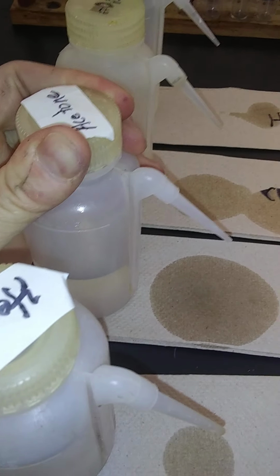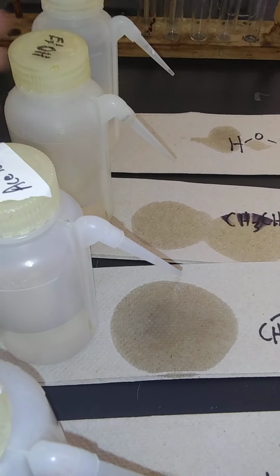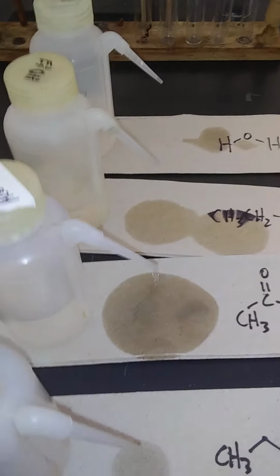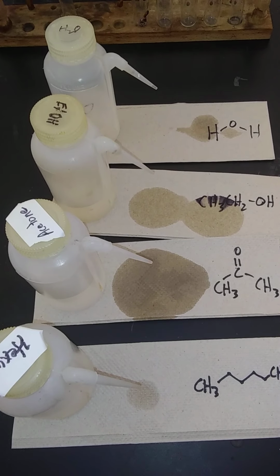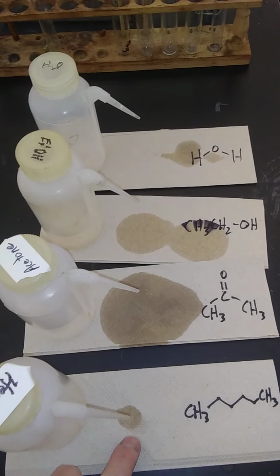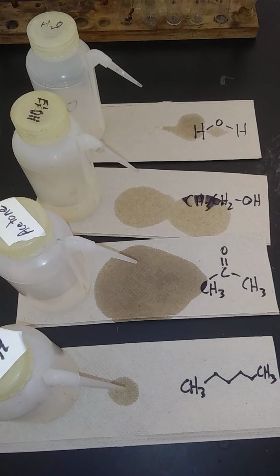So the big take-home message is, with these organic solvents, it's just a good idea to leave the caps a little loose. If you're in the labs, just practical things that you learn as you work in the chemistry lab. Leave those caps a little bit loose if you're dealing with your organic solvent, and acetone continues to drip. Hexane's dripping, but it does evaporate very readily from the paper.